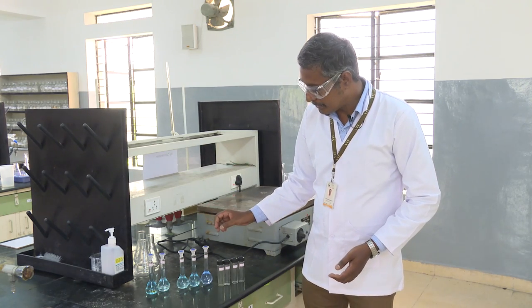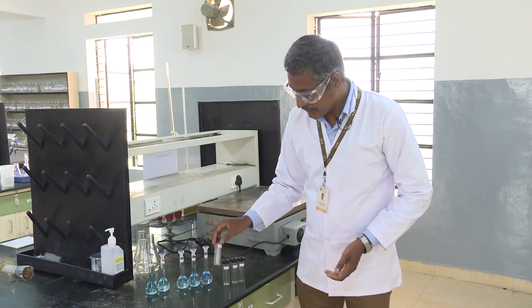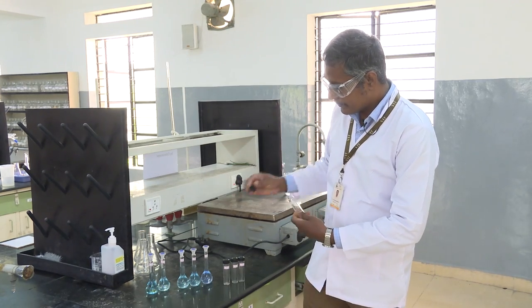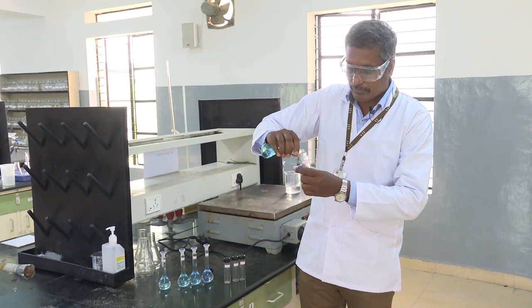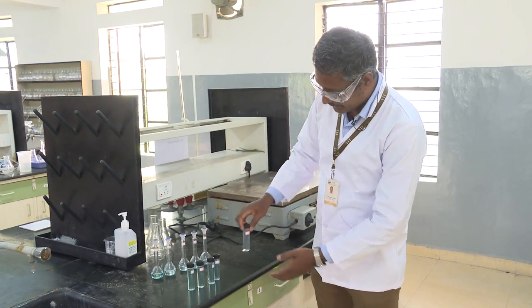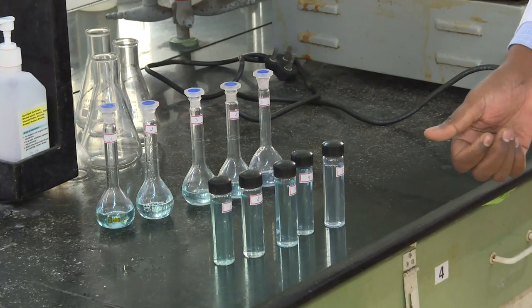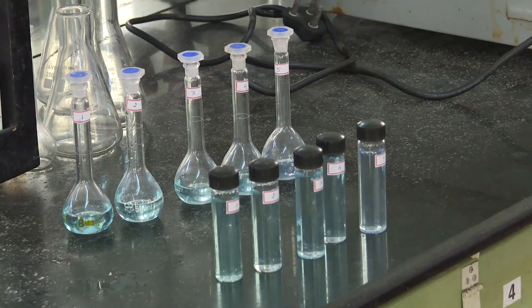Now we have 50 ml of solution. Our next task is to transfer the solution into tubes. We use labeled tubes and carefully transfer the first solution labeled 1 into the first tube. Students, please carefully observe the color of the sample — most of them have a similar color. Now we are going to heat these samples in a water bath.